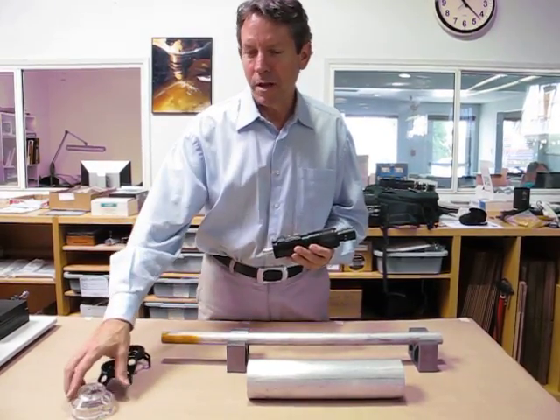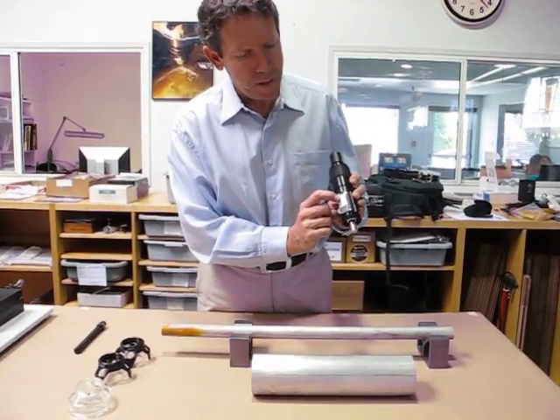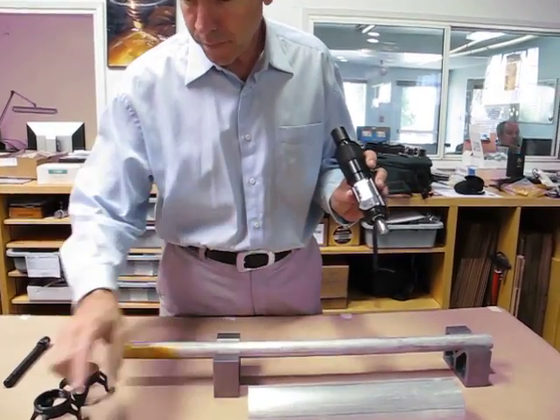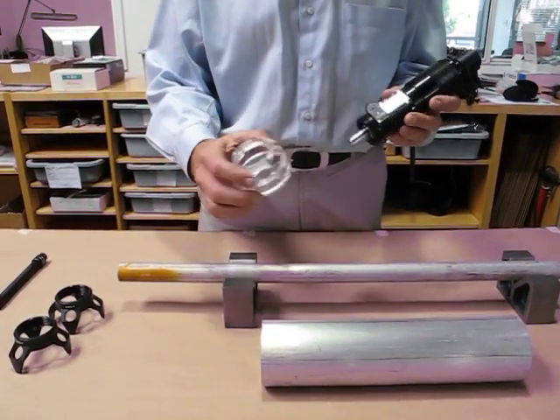Hi, I'm John Chadwick and we have the optical micrometer 8400K with a depth measuring display. I'm going to turn the display on. I'm going to try to measure a scratch on this round surface. We'll use the clear acrylic base.